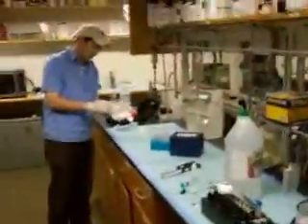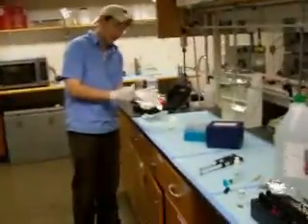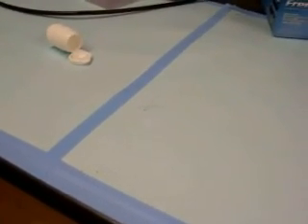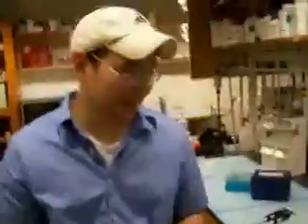Proper gloves have been placed on top of secondary and tertiary containment of your hands. So the spill is very hard to see. Who knows whether you could see it with this camera angle, but it is about an inch to the right of that blue line in the center there. You could see about what has been described as 7 droplets of liquid metal. We're not certain that it's mercury. I'm going to now make an approach and move in to the site.